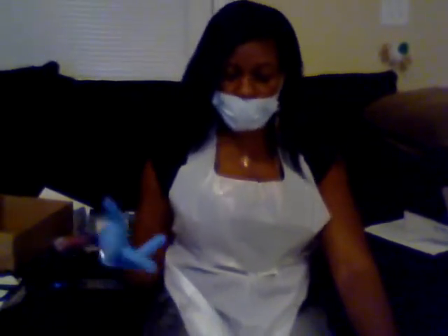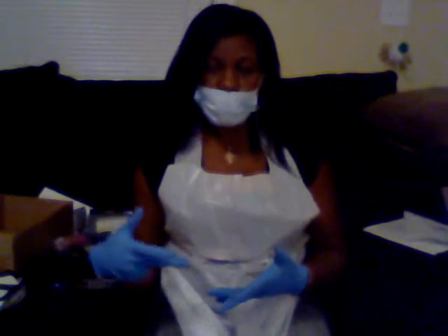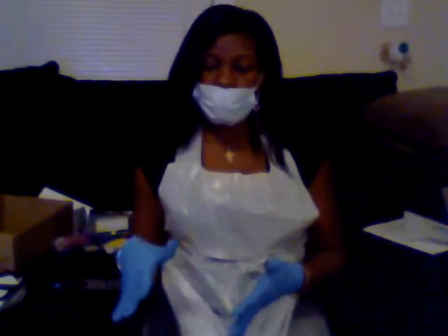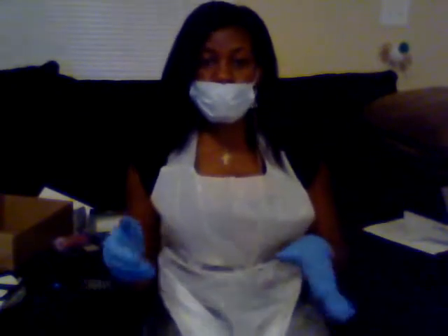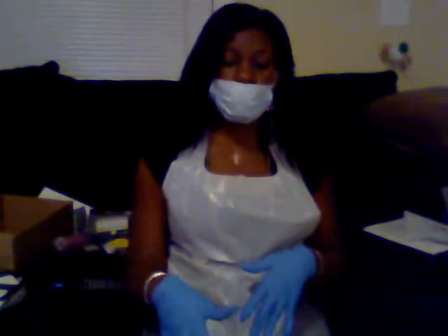As I did on the brain, I had already started cutting some stuff. The outside of the eye is so hard to get to — it's so tough. I went ahead and cut that off before I started so it won't take long; it took me about five minutes to get it off. I'm getting ready to pull my screen down so that you can see what I'm doing.